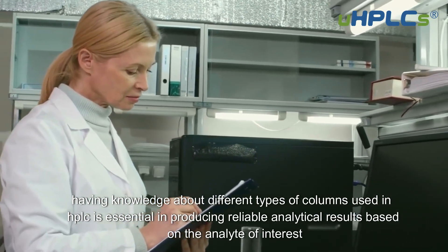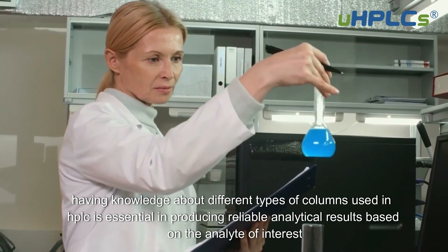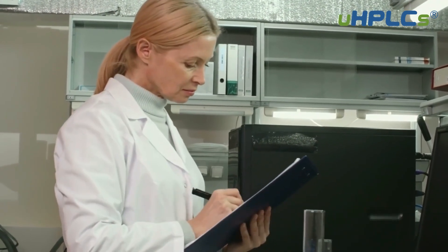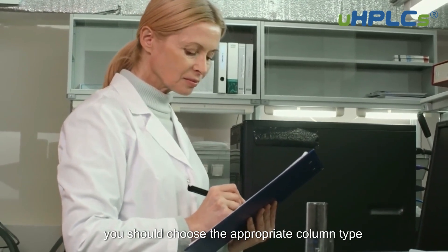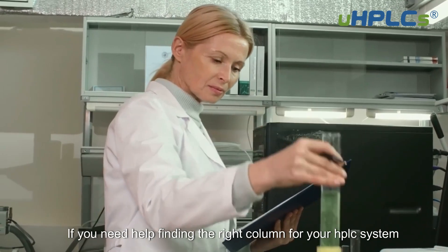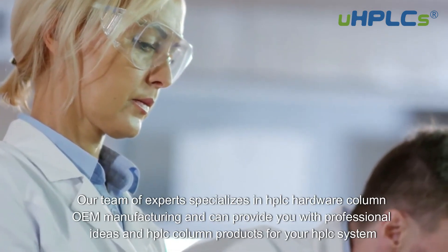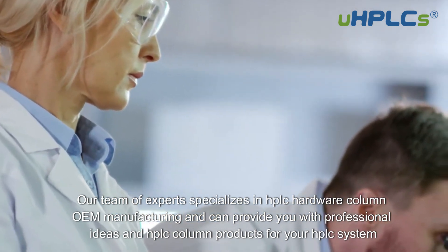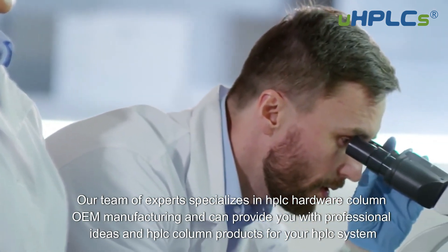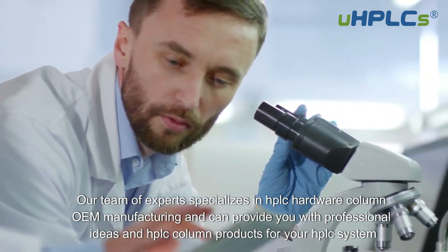In conclusion, having knowledge about different types of columns used in HPLC is essential in producing reliable analytical results. Based on the analyte of interest, you should choose the appropriate column type. If you need help finding the right column for your HPLC system, contact us at UHPLCs. Our team of experts specializes in HPLC hardware column OEM manufacturing and can provide you with professional ideas and HPLC column products for your HPLC system.